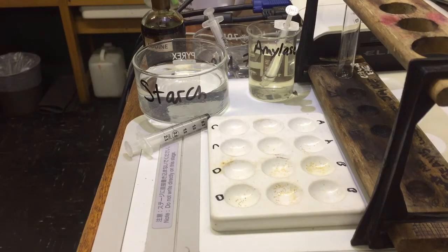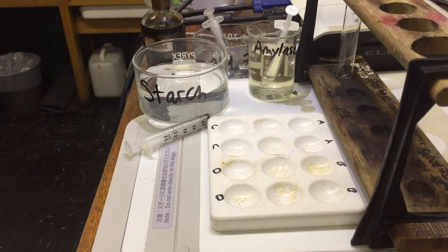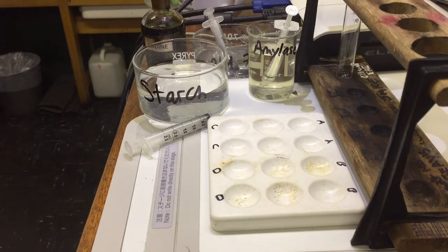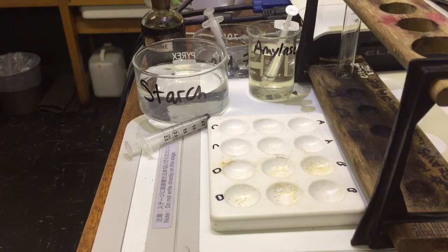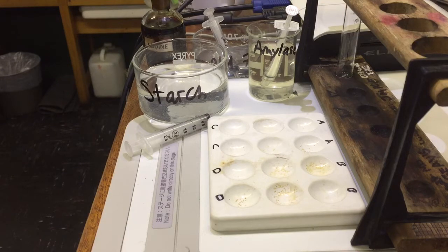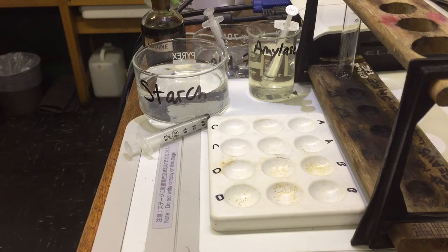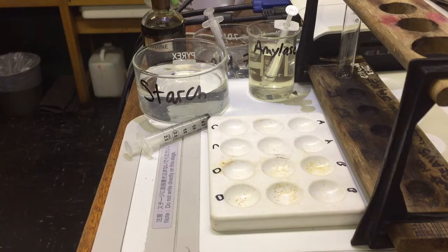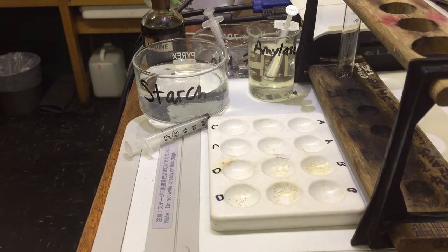What we're going to do today is try and prove how the rate of reaction of an enzyme changes with pH. You can also do this experiment with different temperatures. Our independent variable — the variable we're changing — is we're going to use different pHs.